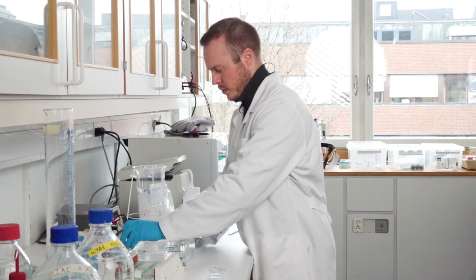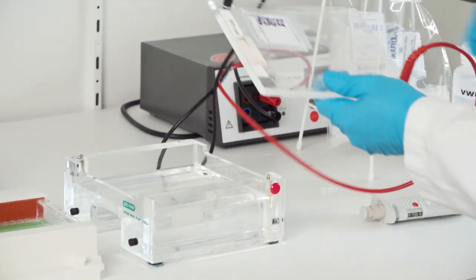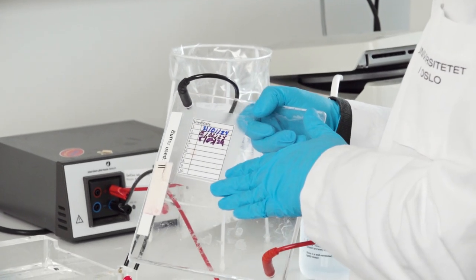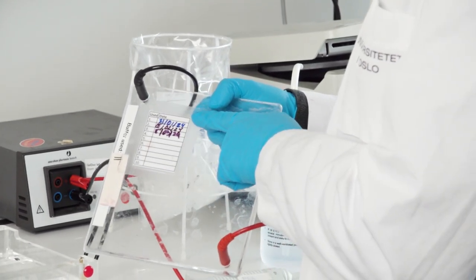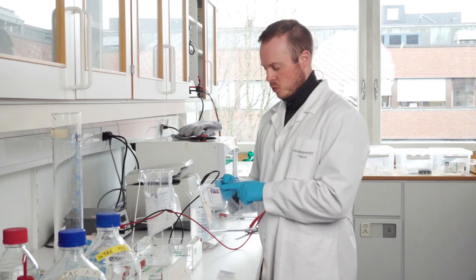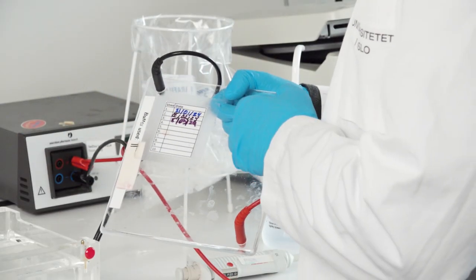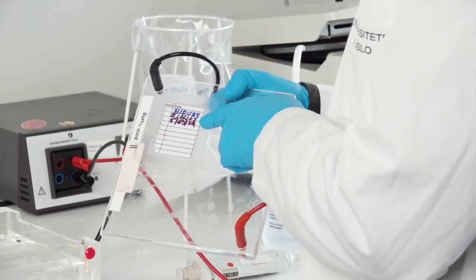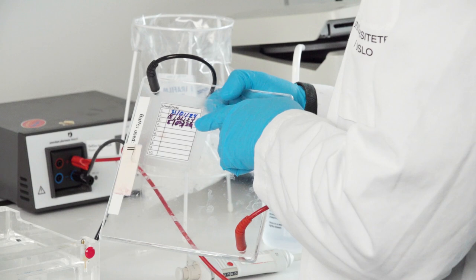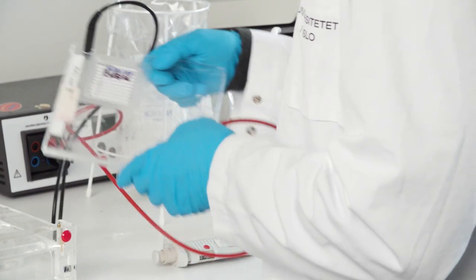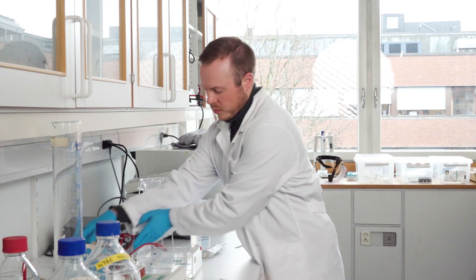Open the lid. And before you actually start doing something you should actually read on the top here because it has a limitation of use that it should be used only 10 times before you actually change the liquid inside. And this one has only been used three times because people write their dates. And I also need to write the date of use today as well. So this is fine to use.